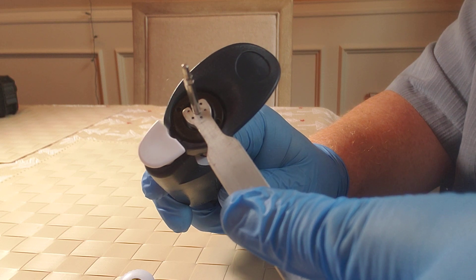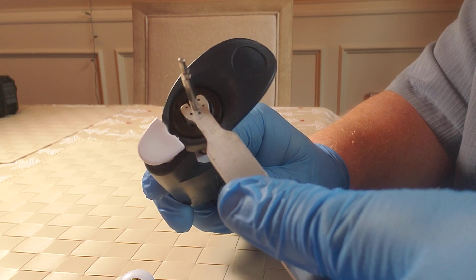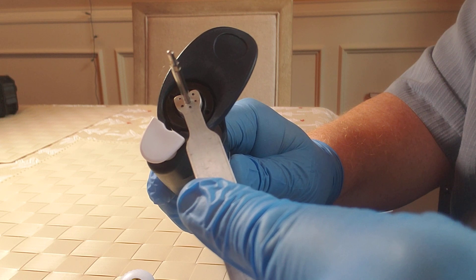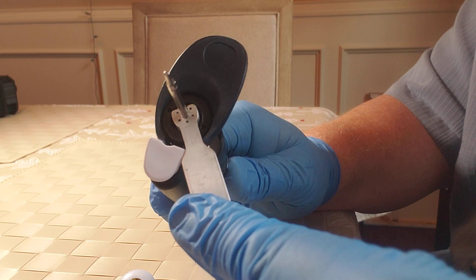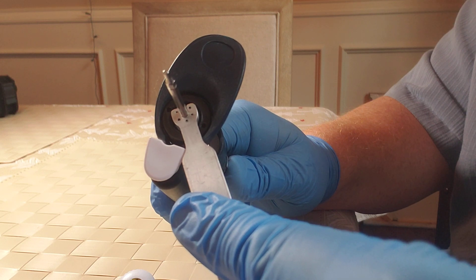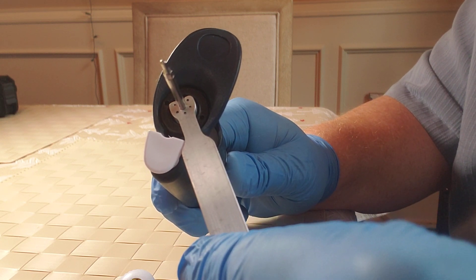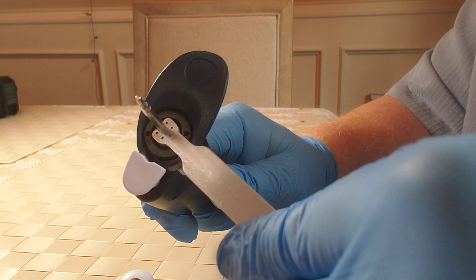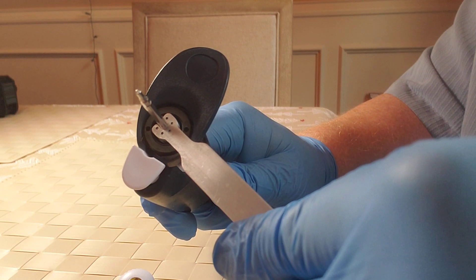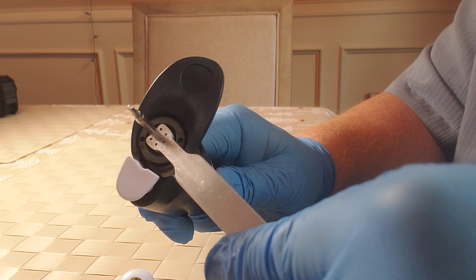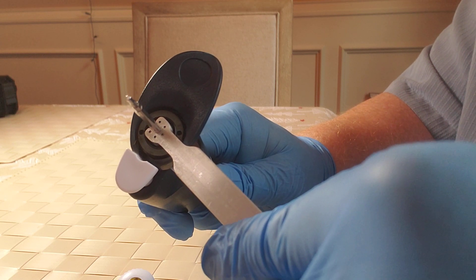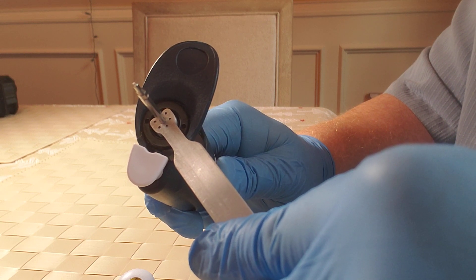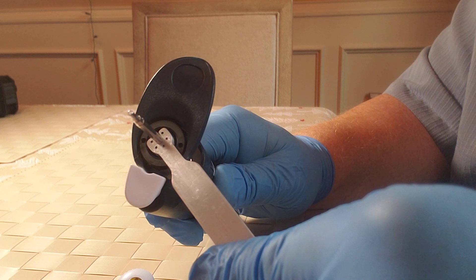If my volume is high and I need to decrease the amount of volume aspirated and dispensed, I would rotate this calibration tool clockwise, incrementally, in order to decrease the amount of volume aspirated and dispensed. It's very important to avoid major adjustments. If I turn the tool like this, that's considered a major adjustment and that will lead to potentially major swings in the amount of volume aspirated and dispensed. So you should make very subtle turns, one eighth of a turn or less, in order to achieve the desired volume that's aspirated and dispensed.